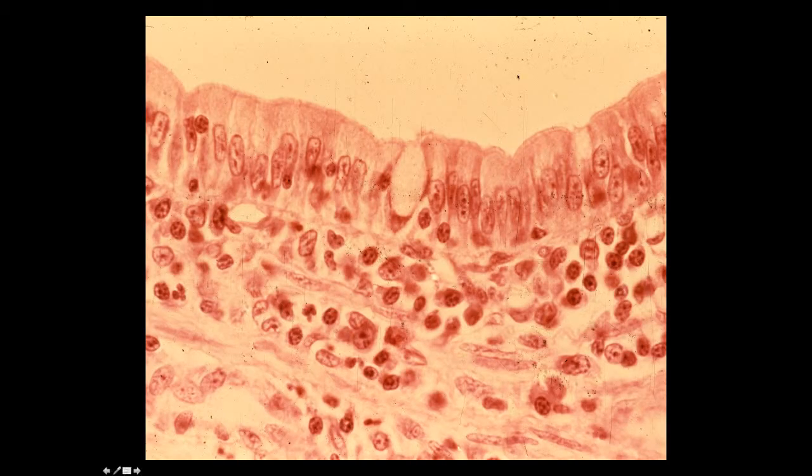Here, a profile through the jejunum in the small intestine, also a simple columnar epithelium. You can see the nuclei. Here you can see a goblet cell, maybe another goblet cell here, and you can get a sense of the brush border. And then this region, again, would be region of lamina propria. For now, if you just understand that the lamina propria is essentially a connective tissue on which an epithelium sits, you'll be fine.